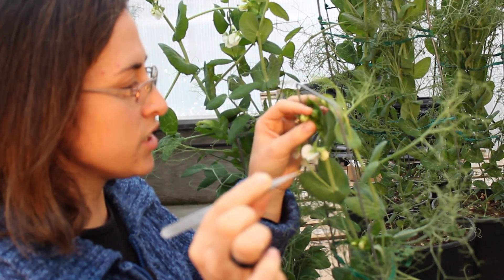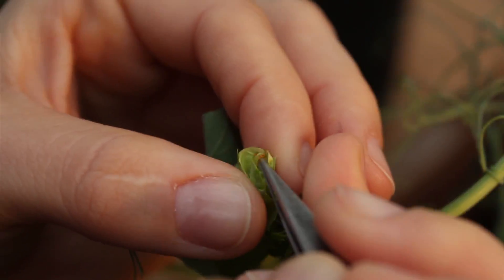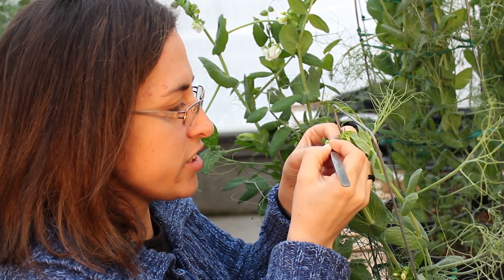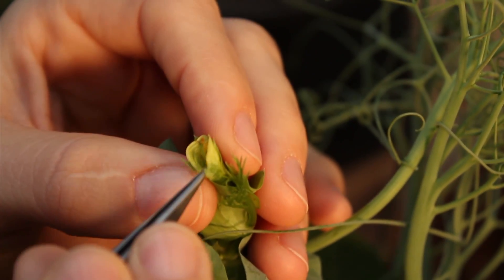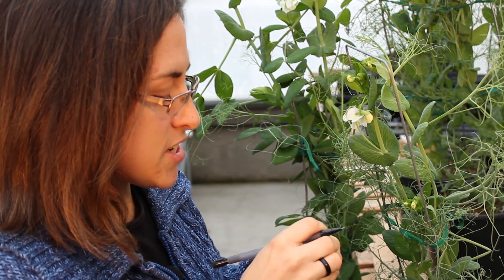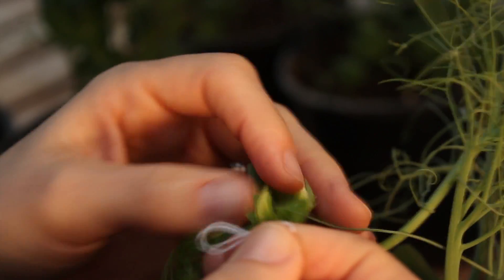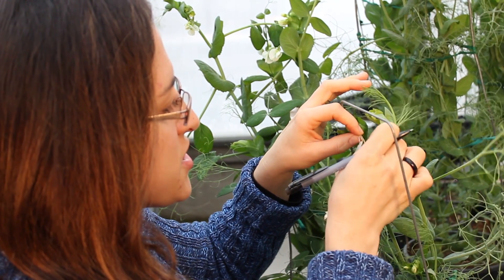And I'm going to place it on my female plant that was already emasculated. I'm going to make sure there's enough pollen attached to the plant. After that, I'm going to close my flower, and I'm going to label it so I can identify it later on. I'm going to go ahead and place the tag in the plant.